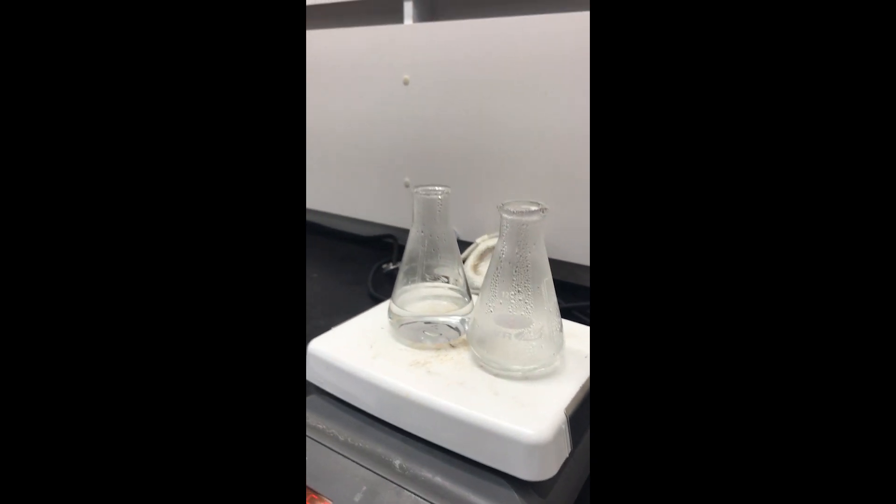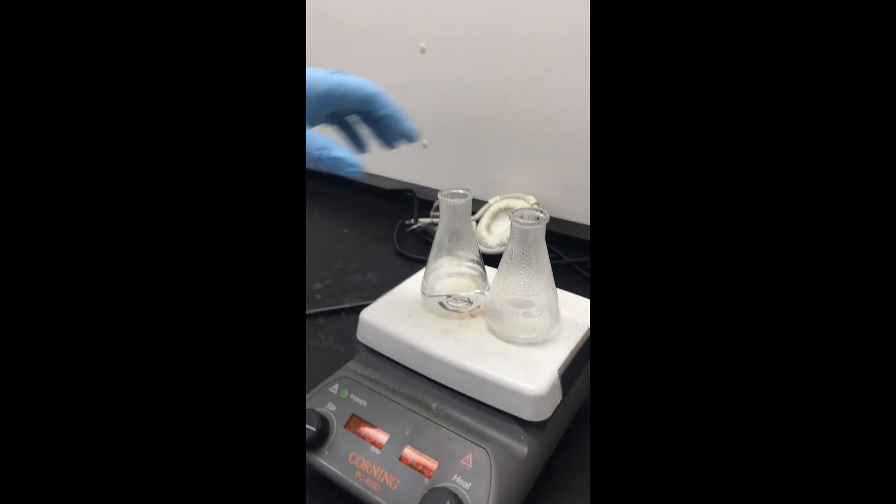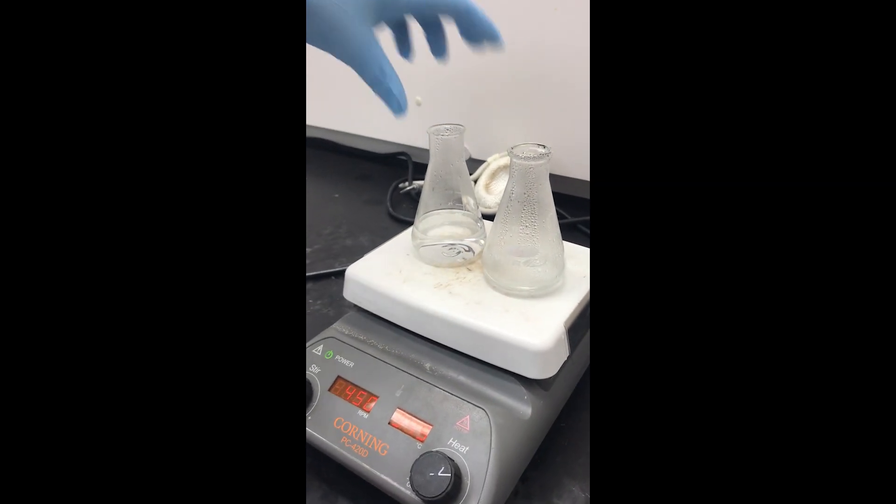Alright, I don't see any more solid, so it looks like the dissolving process has completed.